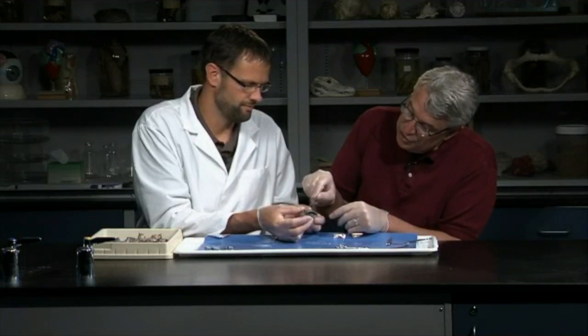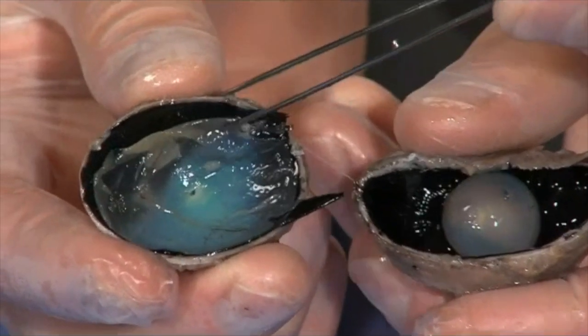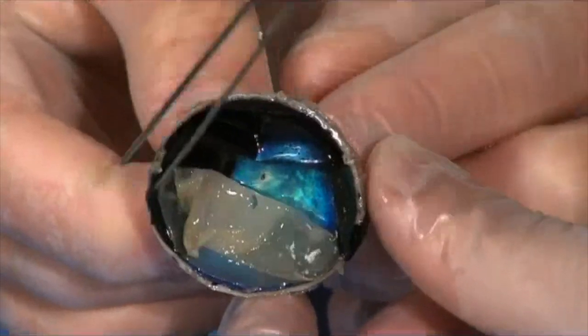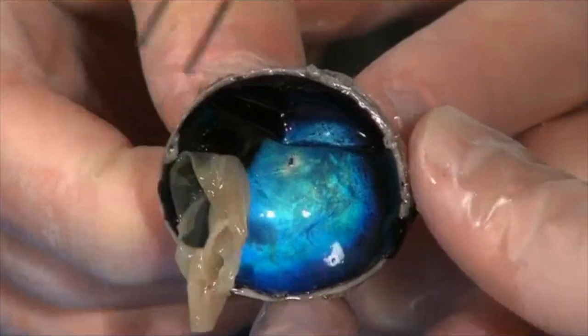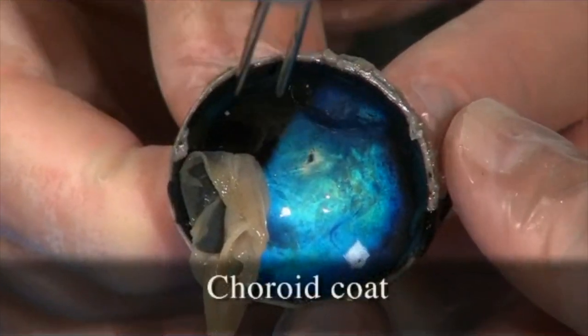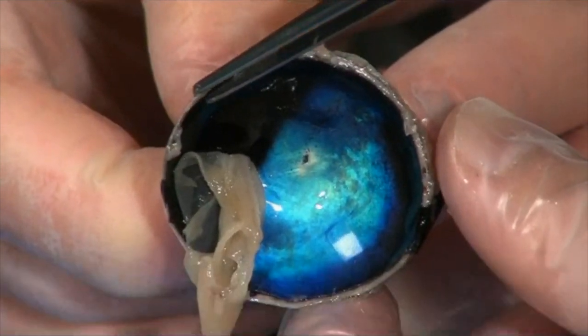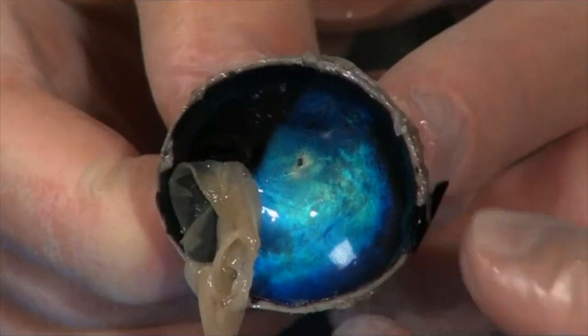Let's do the back first. You can see, here's the retina, and if I pull the retina down off of there a little bit, you can see that there's a dark layer there. This is the choroid coat. The next layer, you can see that layer is only loosely attached again to the sclera. And the choroid is richly supplied with blood vessels. It provides nutrients to other parts of the eye. It's awful dark too, and it's dark and prevents light from scattering, getting reflected around.